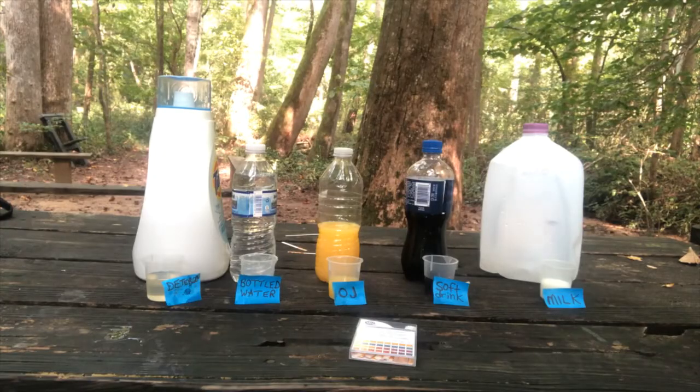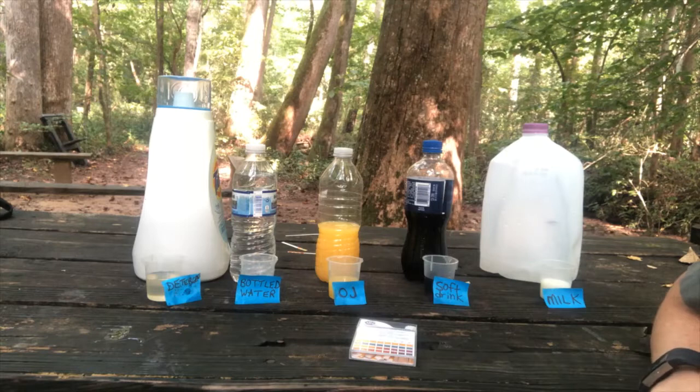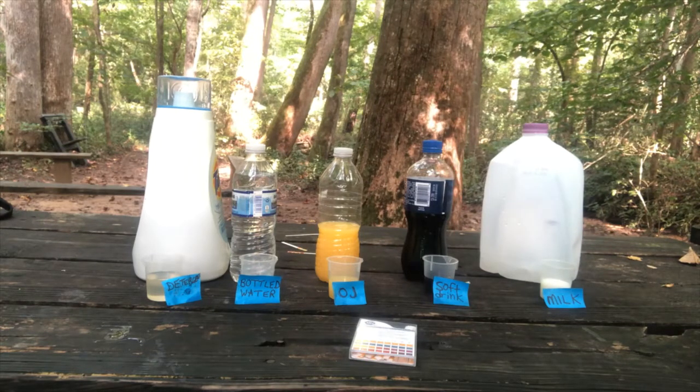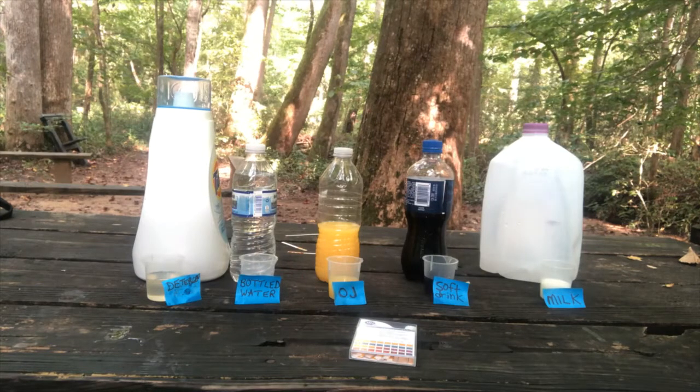When we measure pH, we're really talking about the acidity, right, of a liquid. And so we're going to measure the pH of 5 liquids that were easy to find around school or home, and that just gives you 5 examples of pH and how much it can vary, really. That's kind of fun to try different substances.